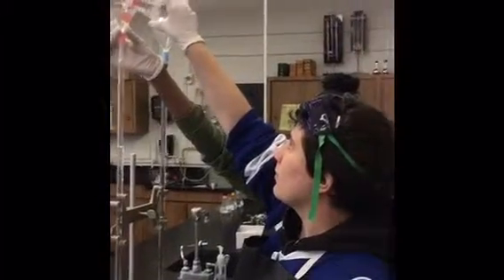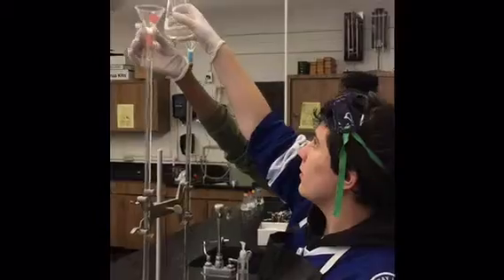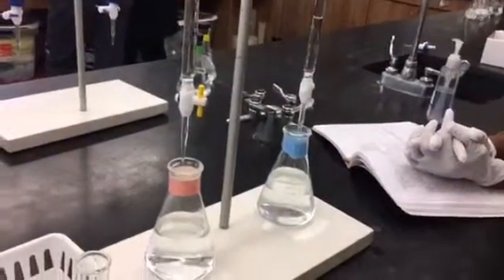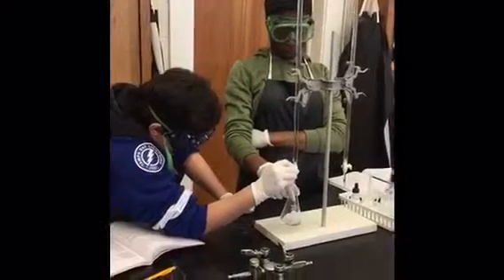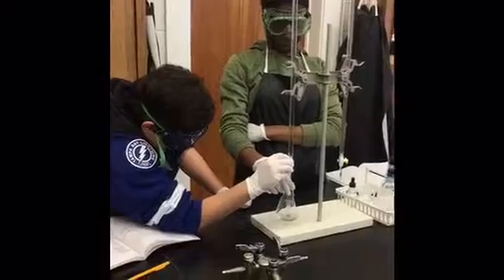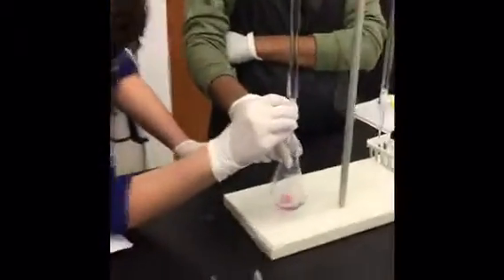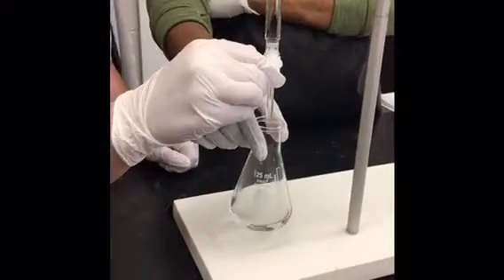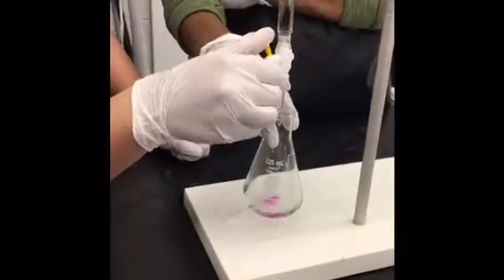First, each burette was filled with the appropriate amount of acid. 9 milliliters of acid were poured out into the flask. Once the acid had been added and 3 drops of phenolphthalein added to that, the base was added slowly in incremental amounts until the equivalence point was reached. Measurements were then taken of the volumes of acid and base used, and later calculations were done to find the acid's molarity.